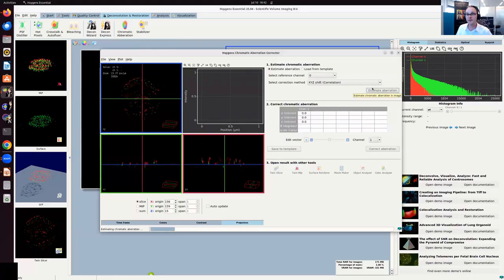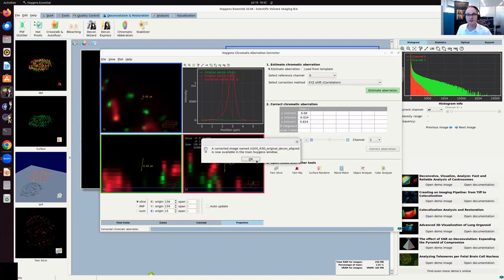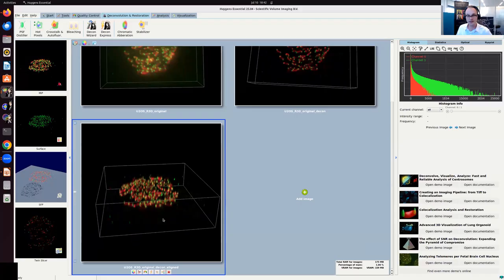So I'm going to hit estimate. And it's now calculating the shift based on the data itself. And it finds here a shift of 600 nanometers in Z. So that's quite significant at this resolution. It also finds a shift of 90 nanometers in X, which is also significant, and a smaller shift of 24 nanometers in Y, which is less significant, but still nice to correct for. So now we've corrected it, and now I have my fully restored data set.